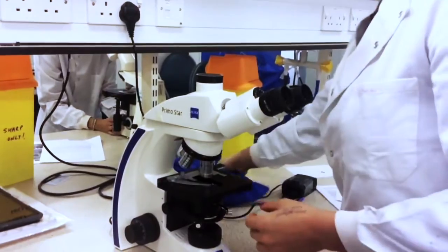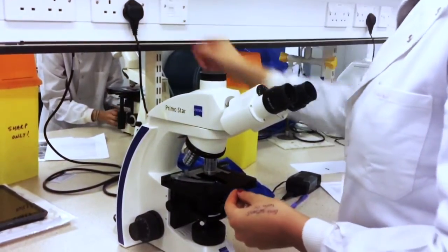Remove the microscope dust cover. Switch on the microscope ensuring the light control rheostat is off.